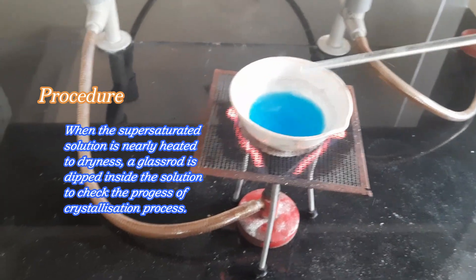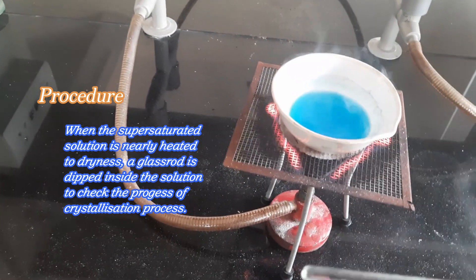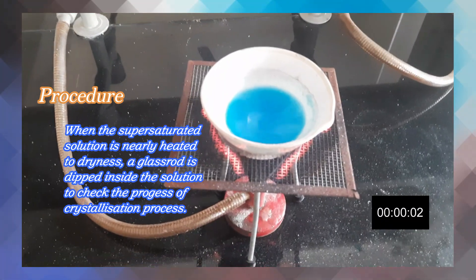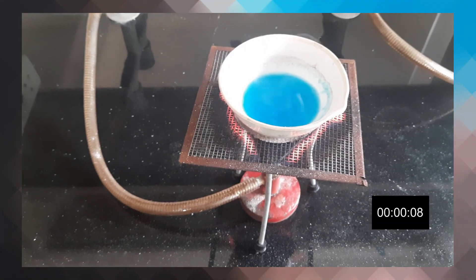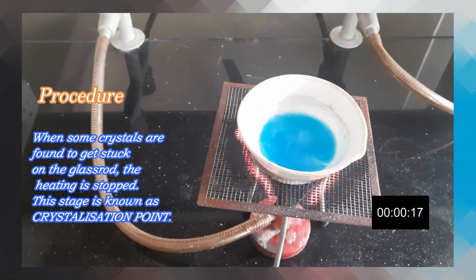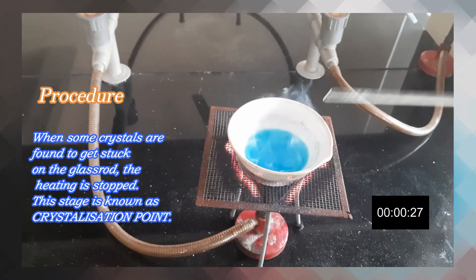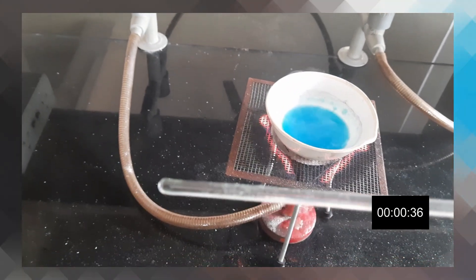When the supersaturated solution is nearly heated to dryness, a glass rod is dipped inside the solution to check the progress of the crystallization process. When some crystals are found to get stuck on the glass rod, the heating is stopped. This state is known as the crystallization point.